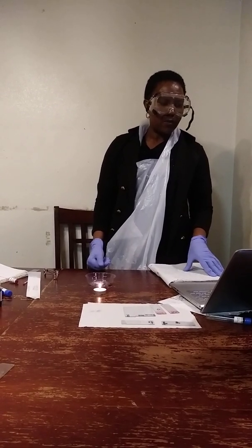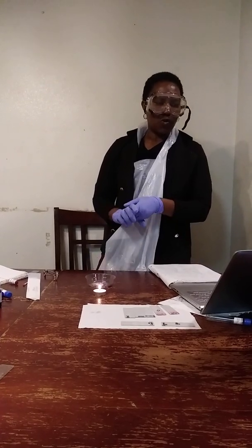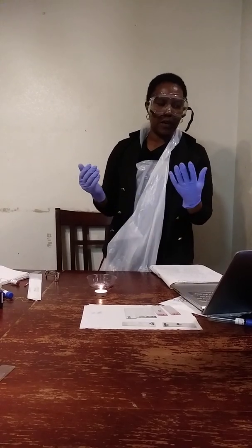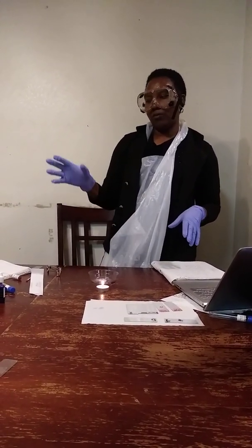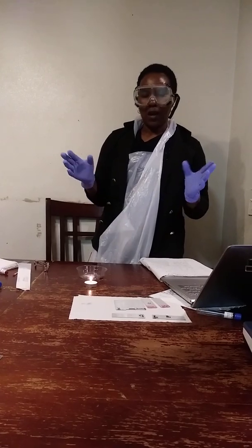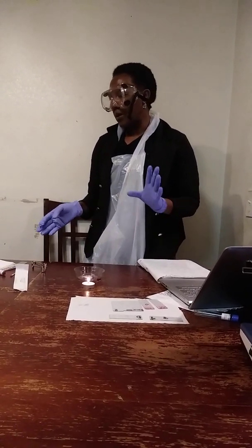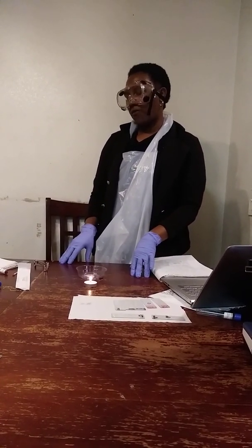And so I will soak the slides and swabs in undiluted bleach for 2 hours, then wrap with paper towels and dispose of them. But I will look at the results on my microscope, and I will be able to classify the bacteria according to size and shape, which is the bacterial morphology.